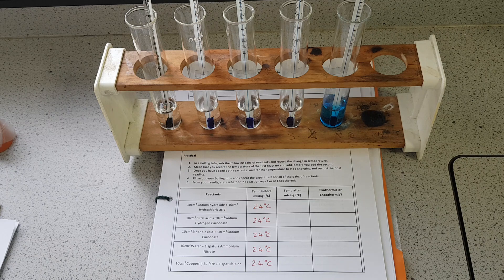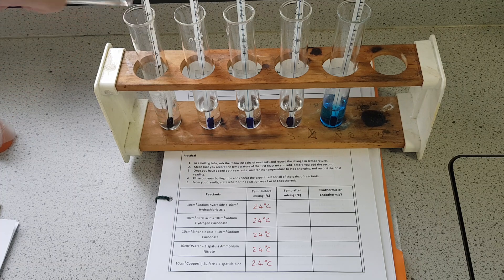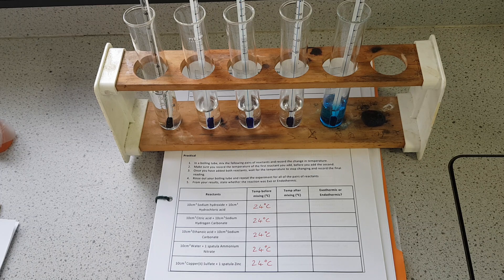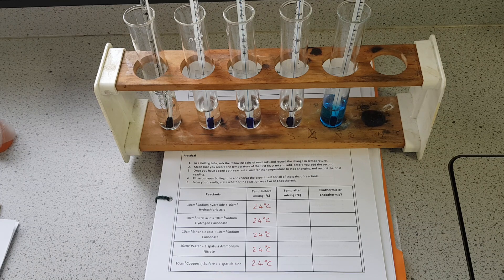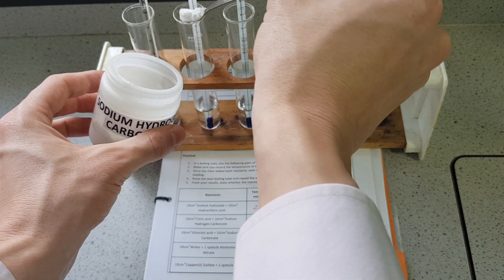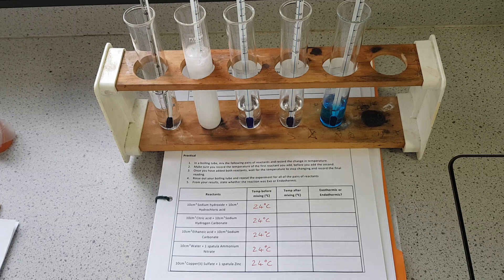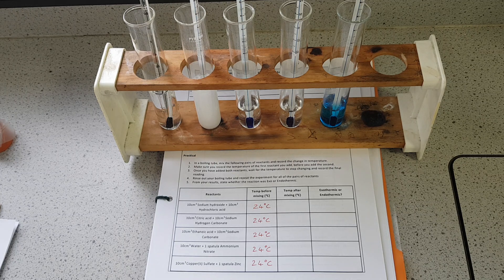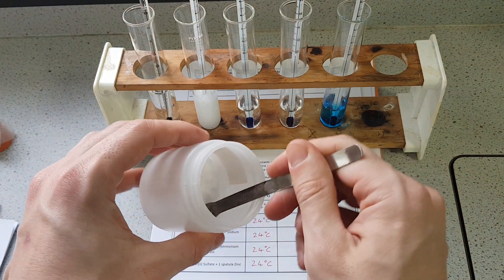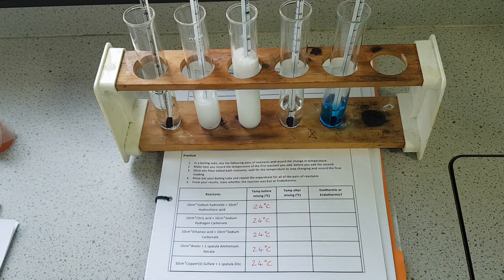We're going to add the hydrochloric acid to the first one. We can see some fizzing occurring — a good sign that a reaction is probably taking place. I'm adding one spatula of sodium hydrogen carbonate to the second boiling tube; a much more vigorous reaction there. And now sodium carbonate to the third one — again one spatula's worth — and again you can see a very vigorous reaction occurring.